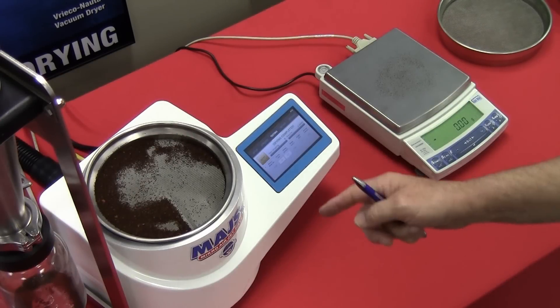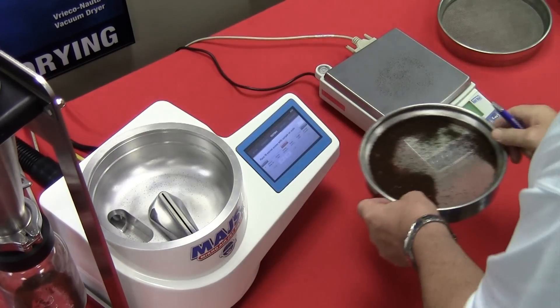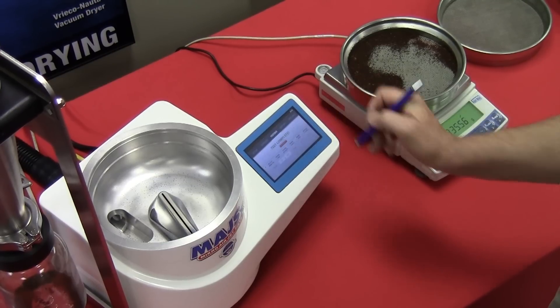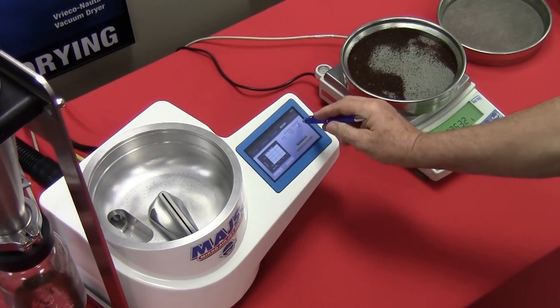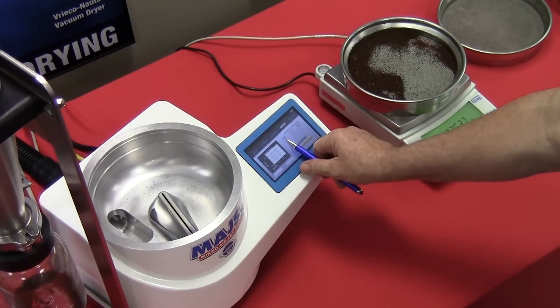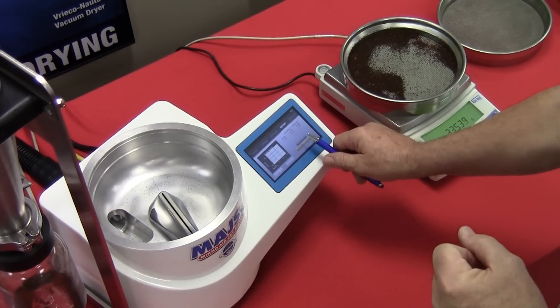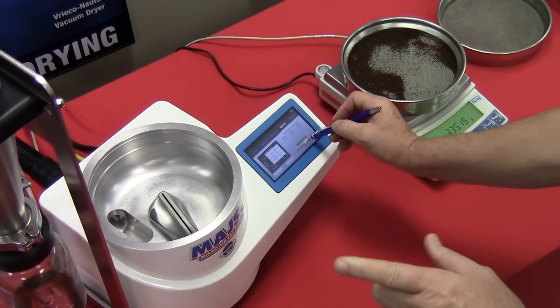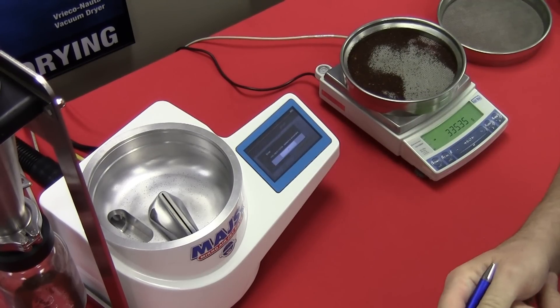Once the time cycle is concluded and the retains are left on the screen, simply press the next button and weigh the sample — as you can see, the test is complete. To generate a report, open up the report page and you get the results, the screen size in both micron and mesh, the cumulative percentage, and the differential percentage. To save, press the save button. To print, press the print button and the print job will be sent to the host print computer.